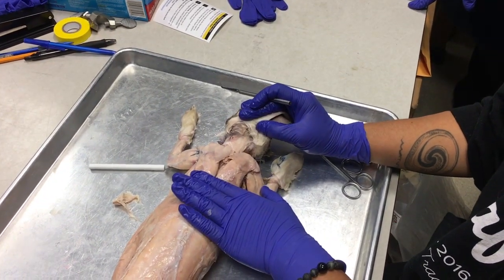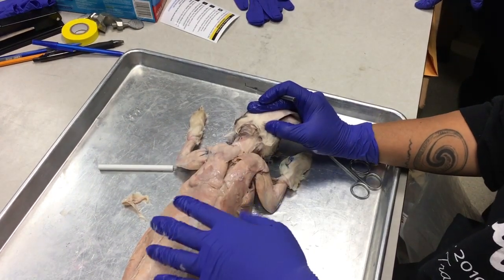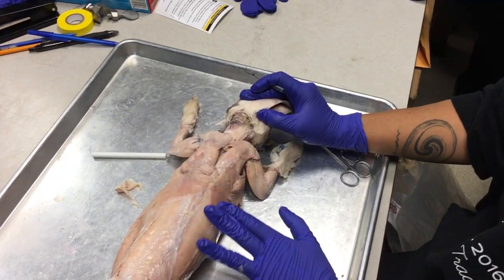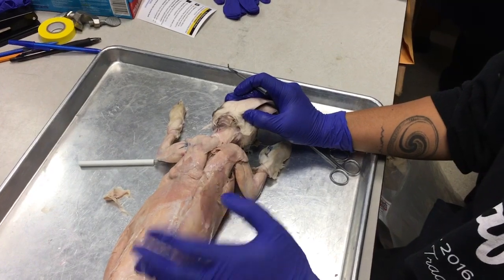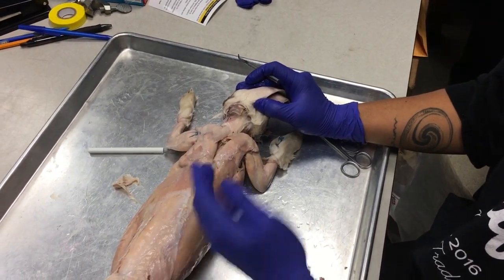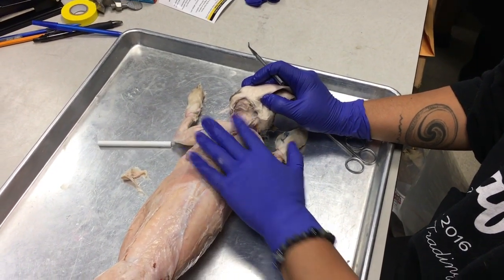I think in your book it's called the clavobrachialis, but since we have a group of three, well, I could only identify two. A group of two deltoid muscles to learn, you can use either deltoid or brachialis. It's just, for me, it's easier to remember deltoid. Okay, so the nape of the neck to the shoulder is the clavodeltoid.